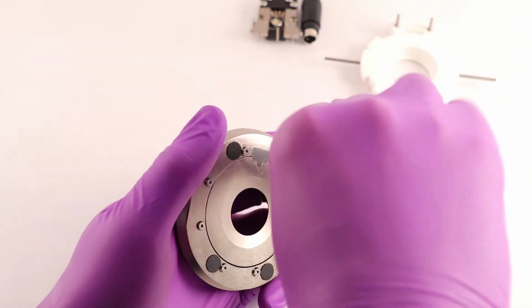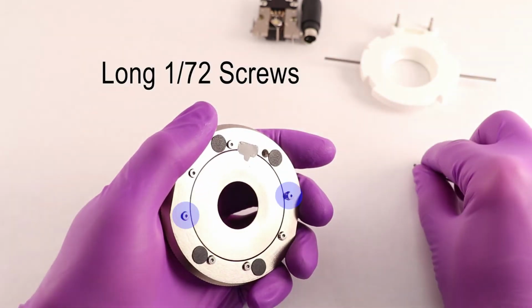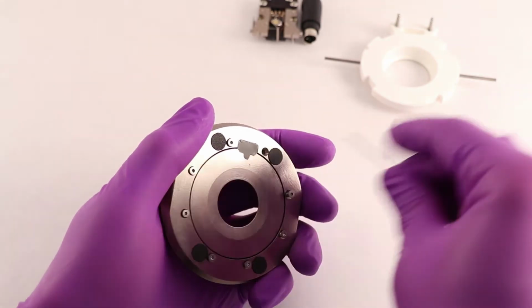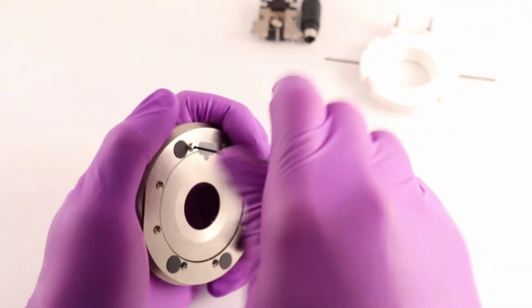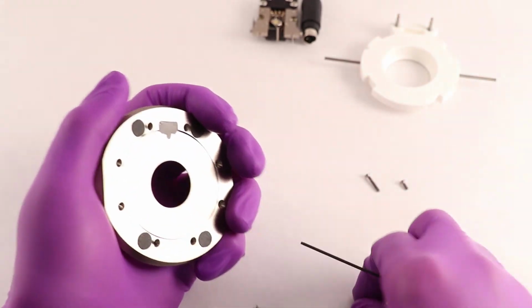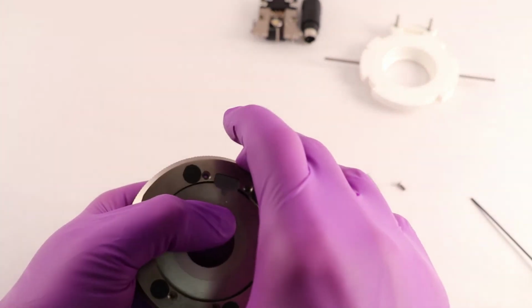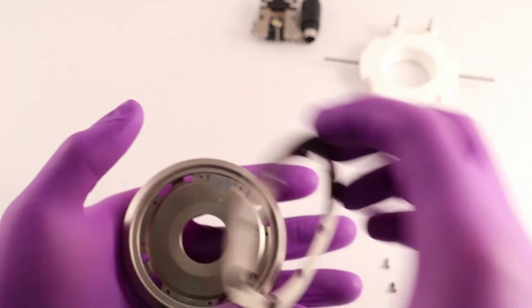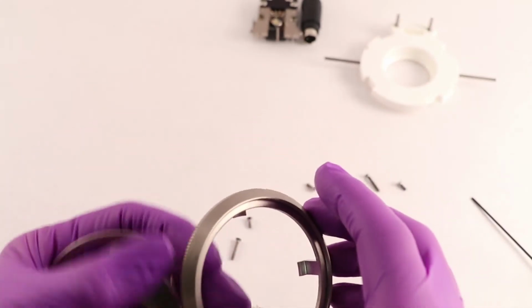Please take note that with the gray epoxy at the top, 2 o'clock and 8 o'clock screws require the long 172 screws. The rest of the screws are the short 172 screws. Once the screws are removed, take off the dovetail and then take the 4-paw and knurled ring away from the base.